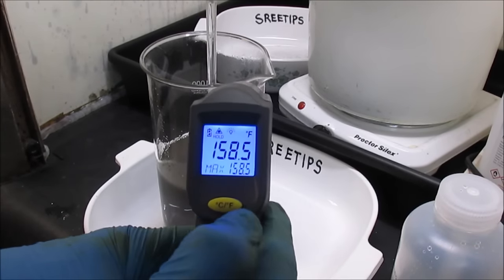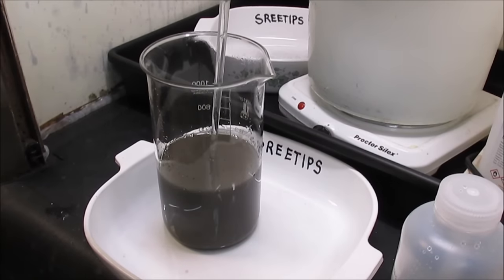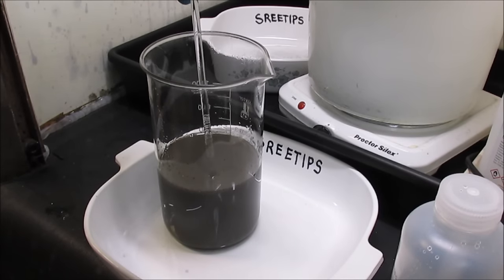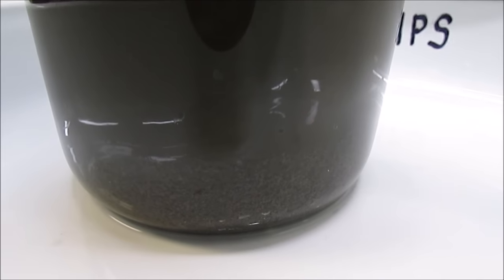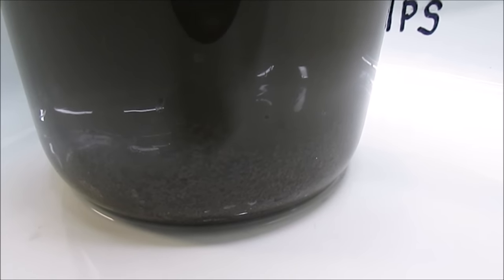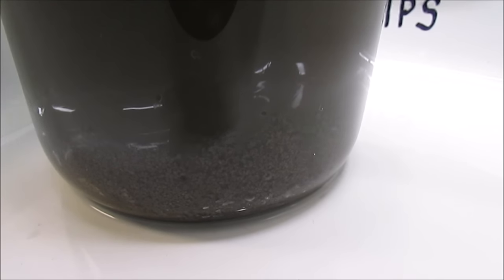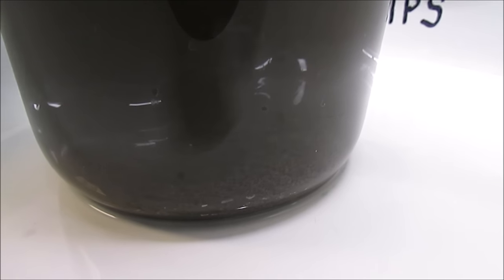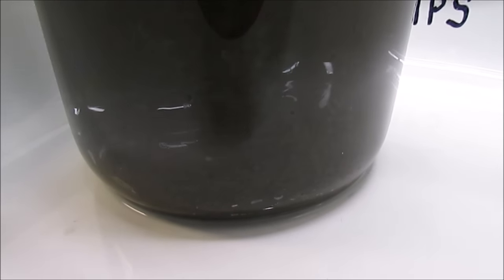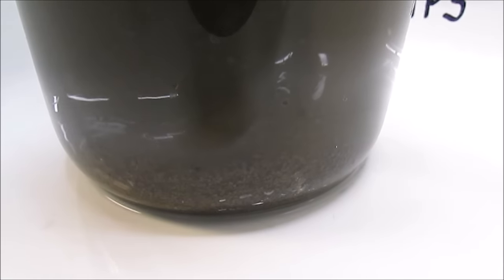It's at 158°F — I put cold tap water in there, remember? That's 70.4°C. I can see the silver on the bottom of the beaker — it's all converted to silver now. Pure silver metal, as if by magic. Here's our pure silver metal powder that's been converted from the silver chloride. I'm going to let this settle, then start rinsing all the lye and sugar off that silver, then we'll get it into a melt dish and get a yield on it.